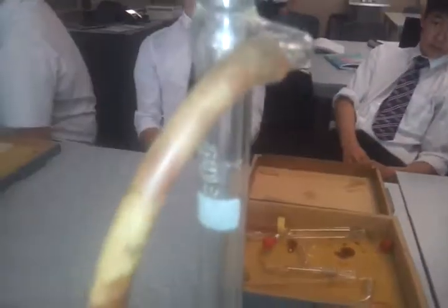But again, you can see we've got a condenser. So it's going to be cooling the vapour down. As we heat this, we are going to have cold water going around the outer tube again, and then coming out here into the sink. And as any vapour comes up here, it will be cooled down, and it will recondense and fall back into the vessel to continue reacting. This will keep happening until we've got our final product. In this case, it would be ethanoic acid.